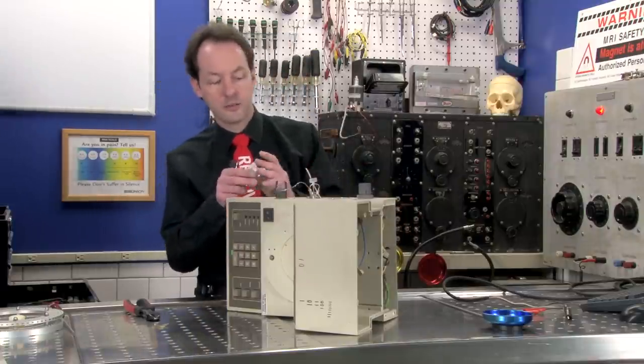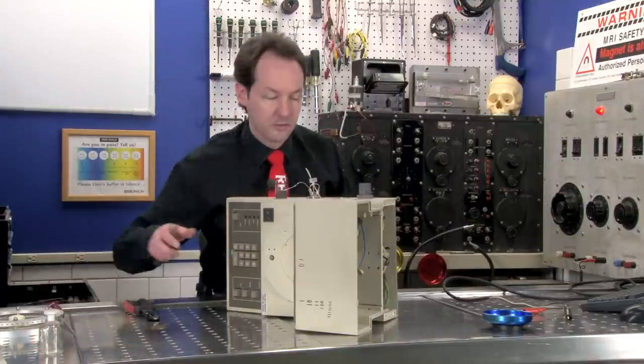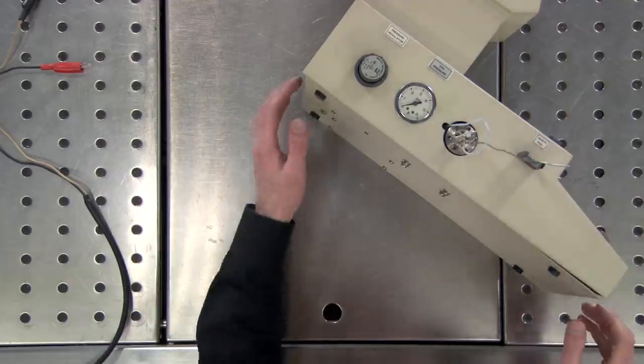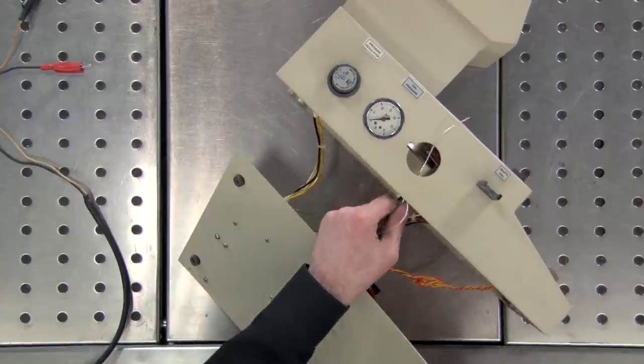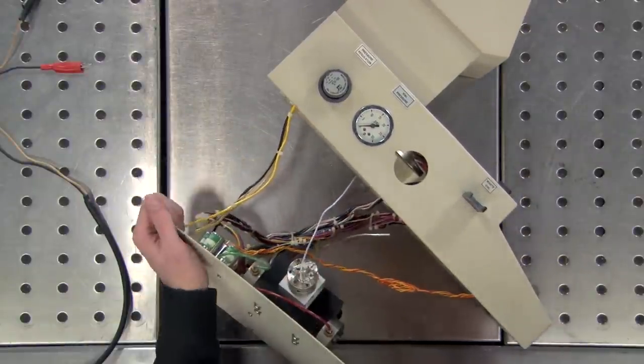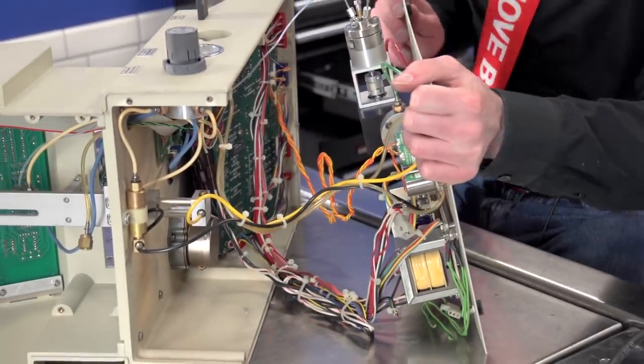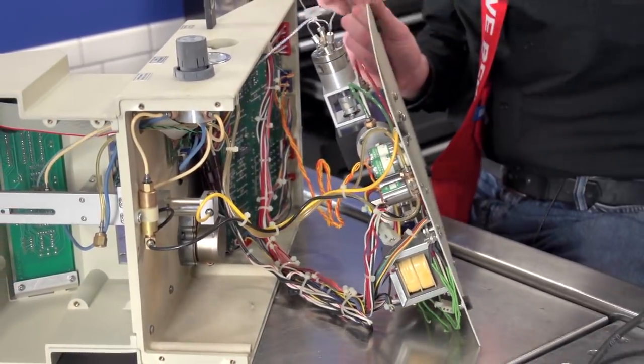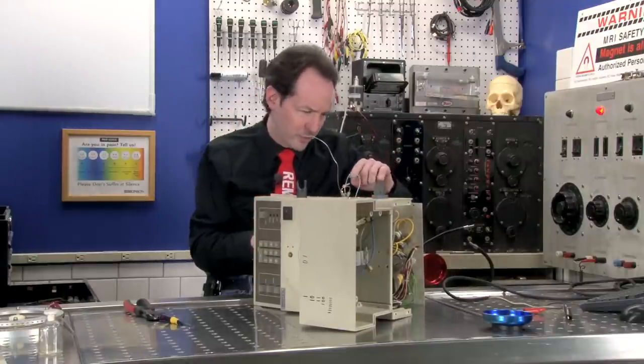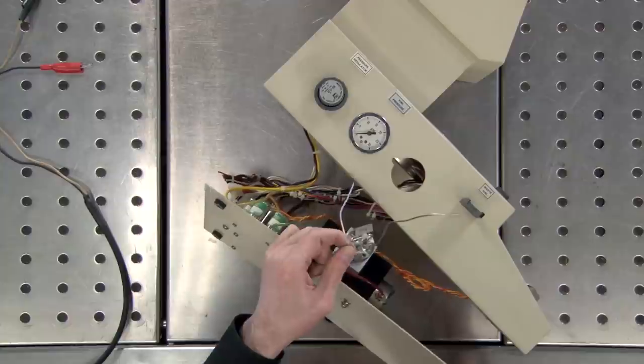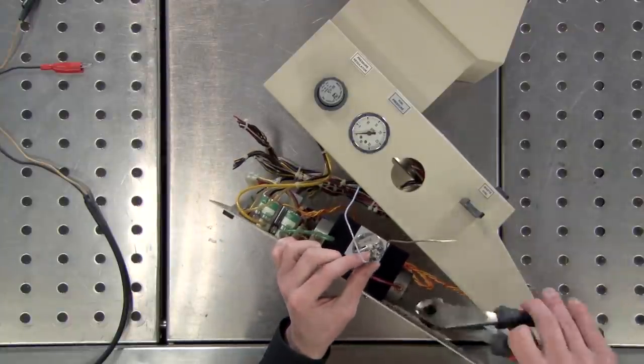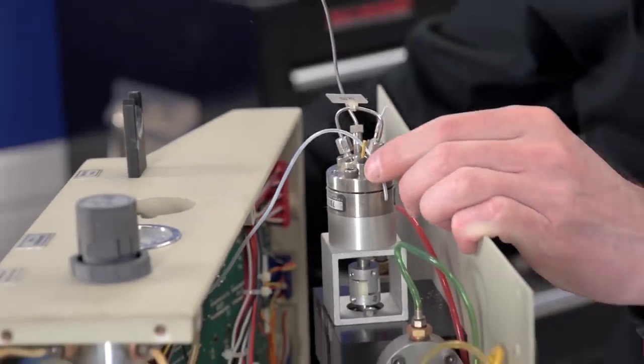That's going to have to feed through that one. Come on out. Oh, there's a little gear drive of some manner. We don't need that. Oh, I thought that was a tube. There's actually a little, either a wire or a really tiny, tiny tube inside that. So I'm going to cut it, because it's not worth fighting.